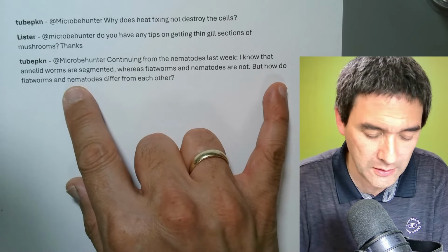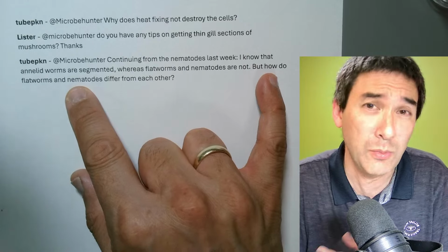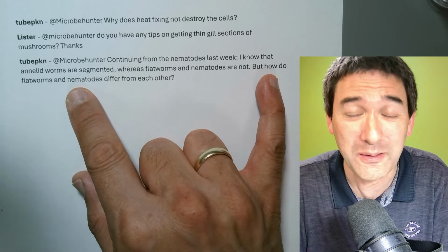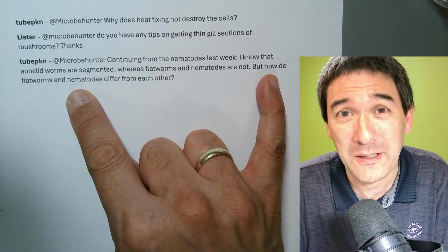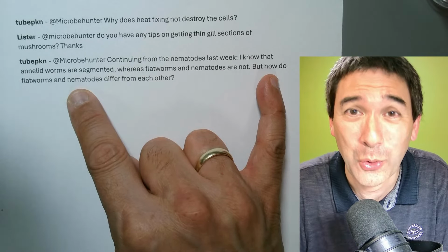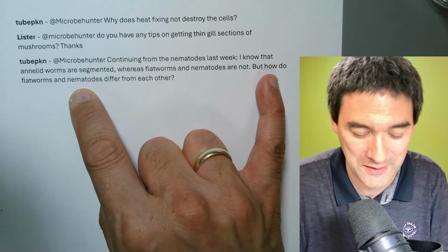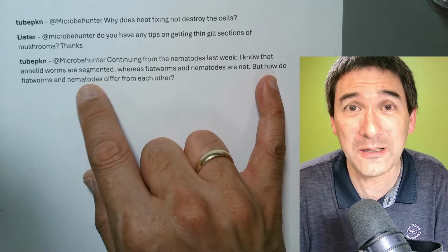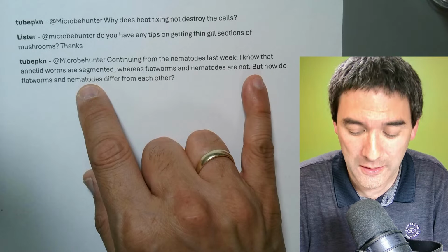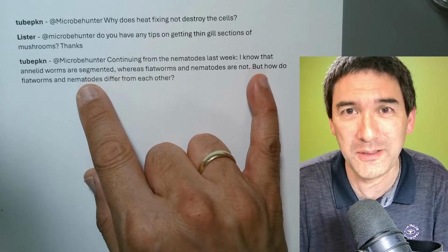But if you want me to, why not do a little live stream segment on different types of worms, like for example Aeolosoma, which is a segmented worm, and then the nematode worms. We've got some vinegar eels here as well, which are basically non-segmented worms. Essentially, they're two different phyla in the animal kingdom.